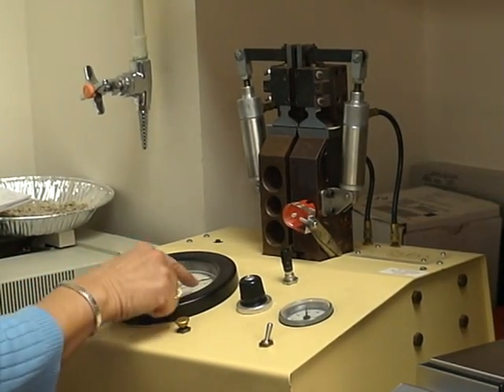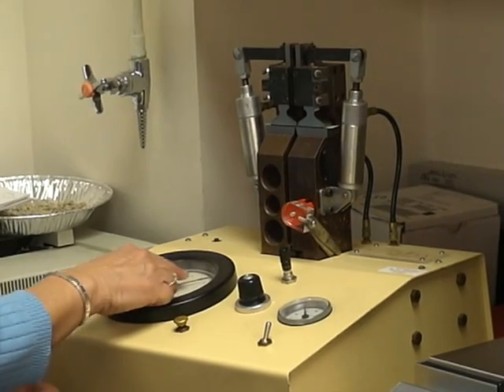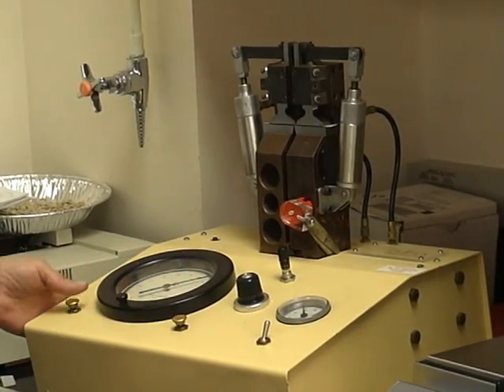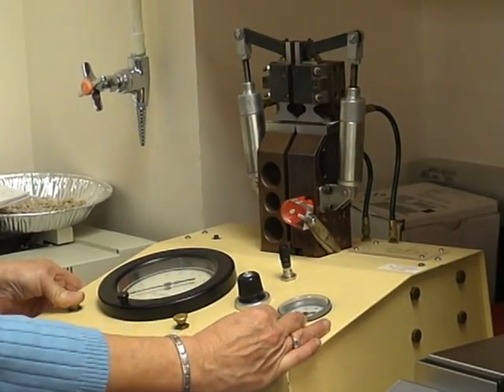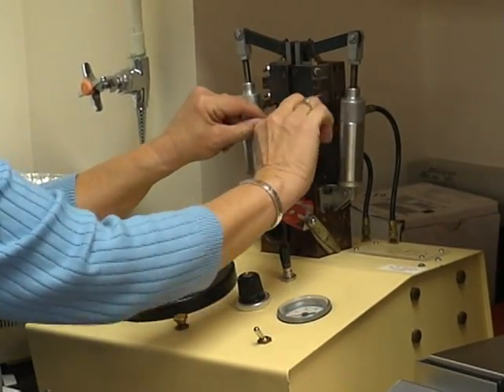Read off how many psi you have off the gauge. In this case it's 39. And then we can reset it to zero and turn our switch back off to release our sample.